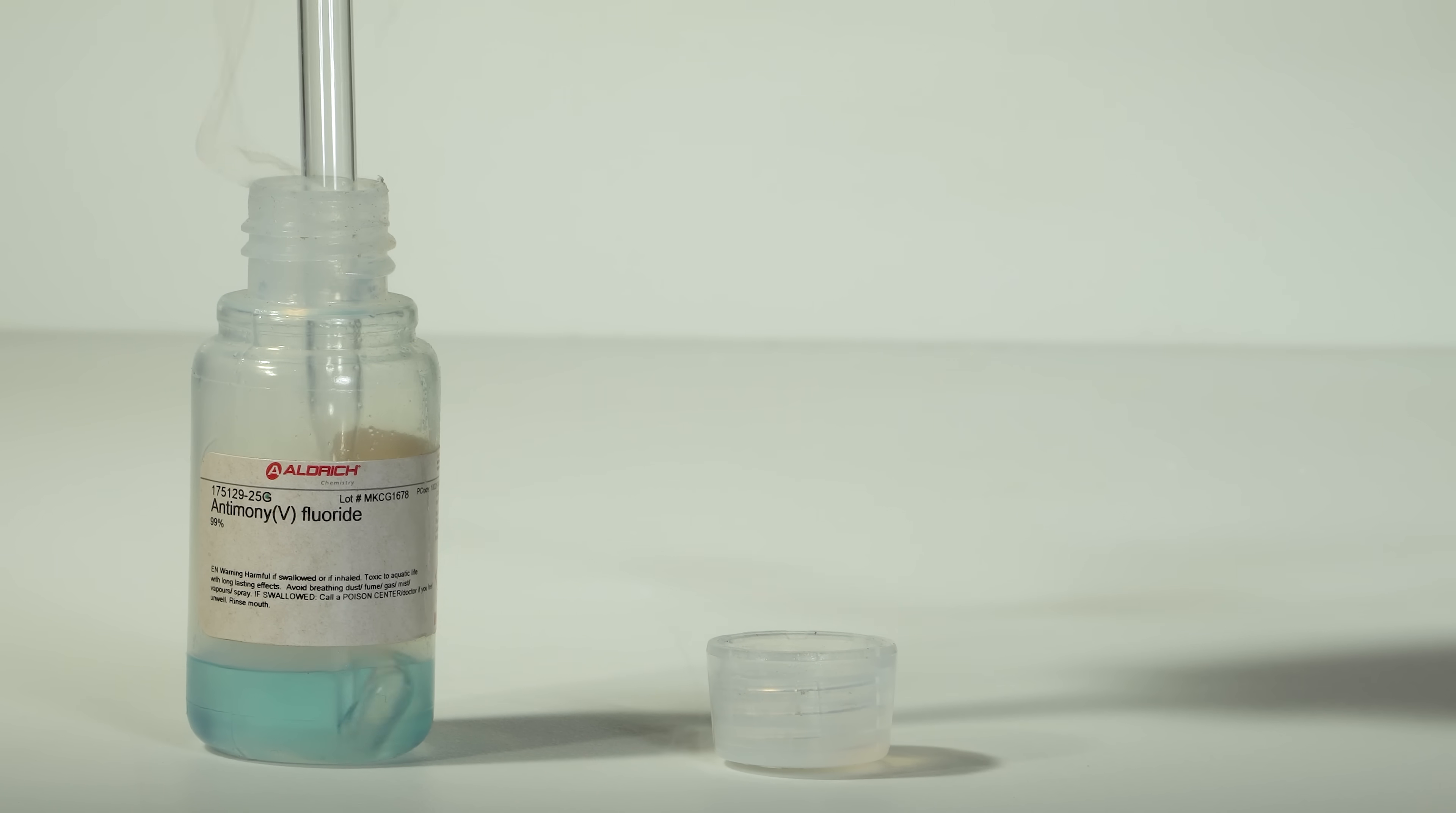Antimony pentafluoride is a high viscosity liquid, and it's quite hard to fill a pipette with.